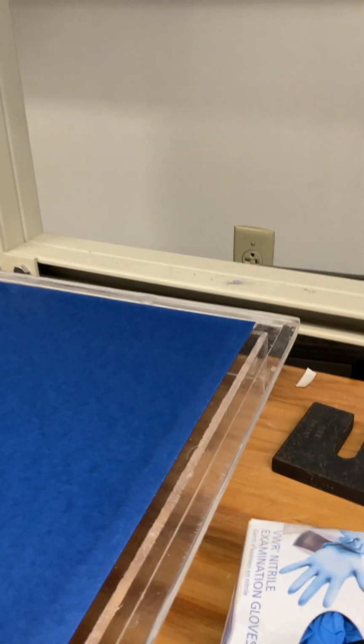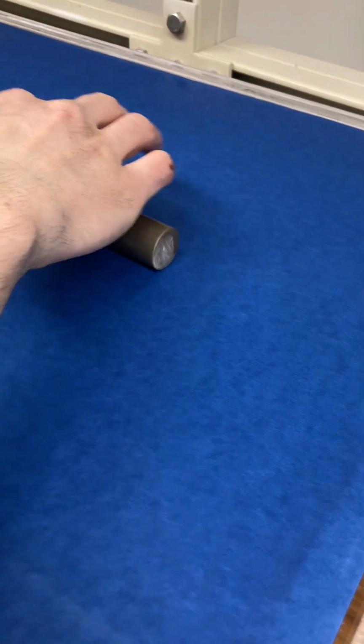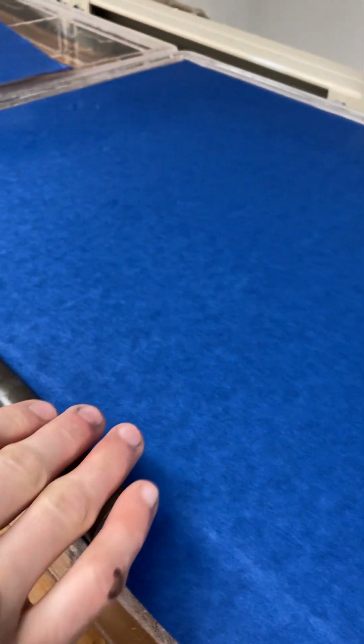How long does it usually take to get that? Just a couple minutes. It won't be long. You'll be able to actually see the outline of the screen. You can see it already, kind of on the corner here. So that's good. We can continue to do this, but we shouldn't really need to push anything else out of here at this point.